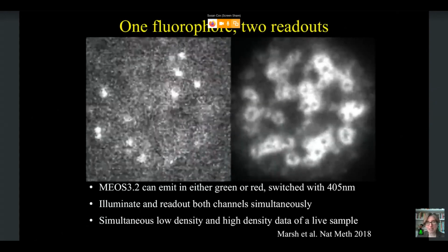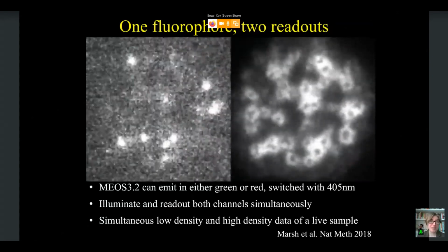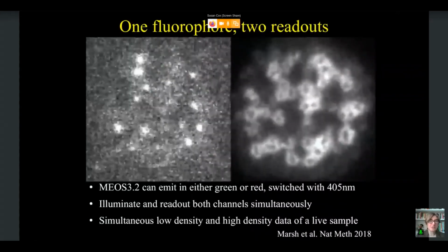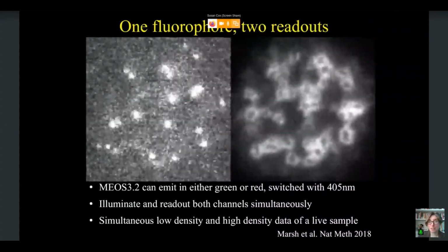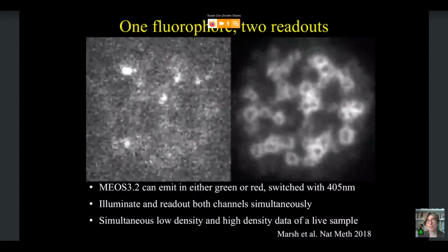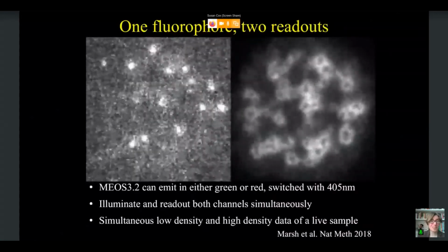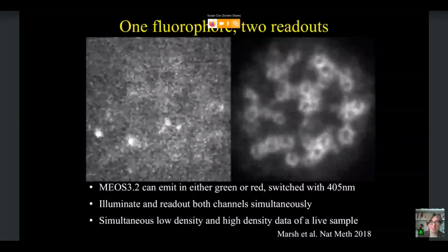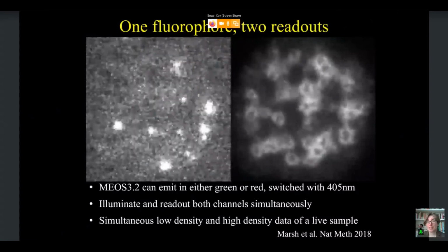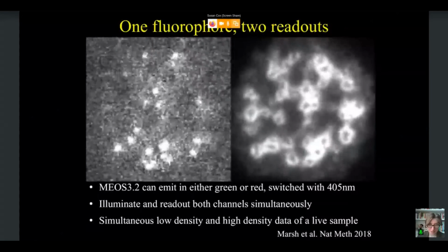Now, I'd started out by saying that what you might want to do is live cells, and obviously testing in live cells is pretty difficult. But what Richard had the idea of doing was using MEOS 3.2, which can emit in either the green or the red, and you can switch it between those states using the 405 nanometer laser. And what we were able to do was collect both low density and high density data from the same live sample, which was a really neat way of benchmarking what the performance of the algorithm was in real live cells as you might encounter them in a real experiment.